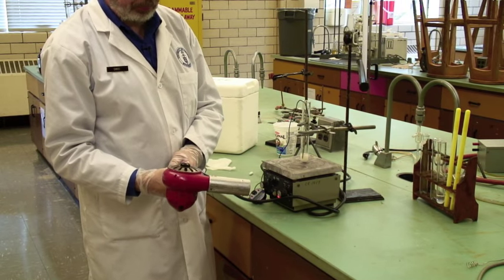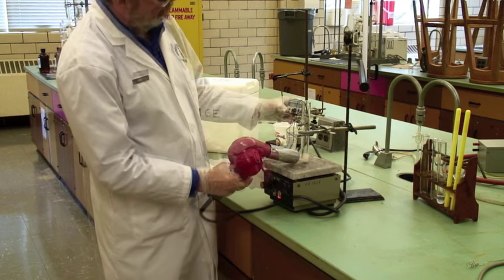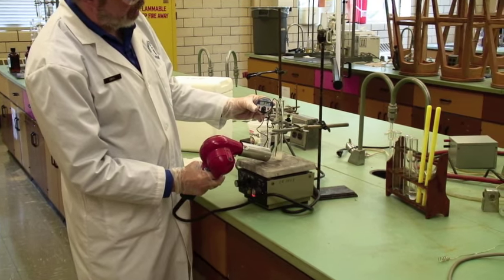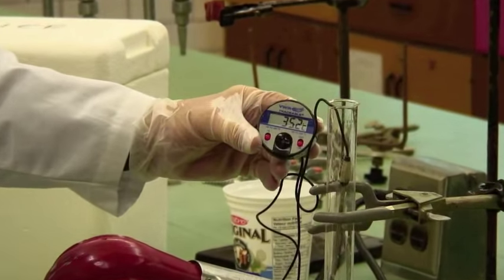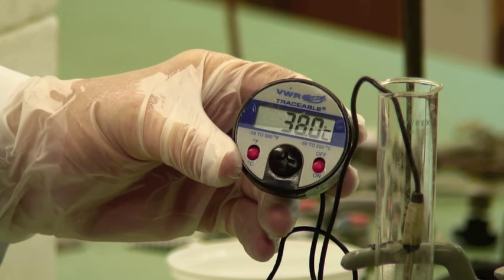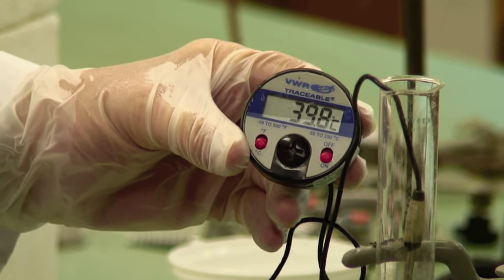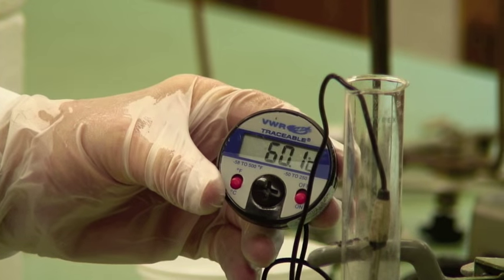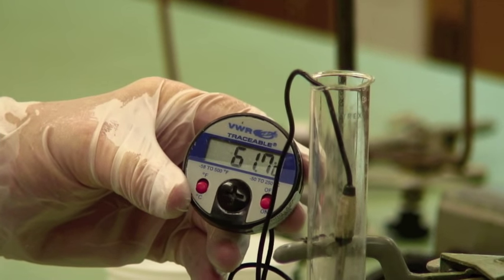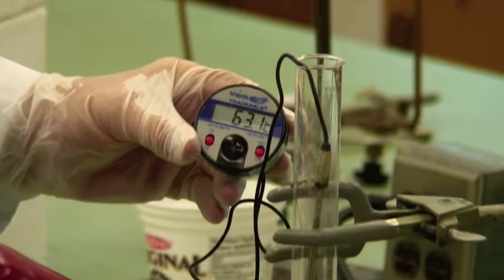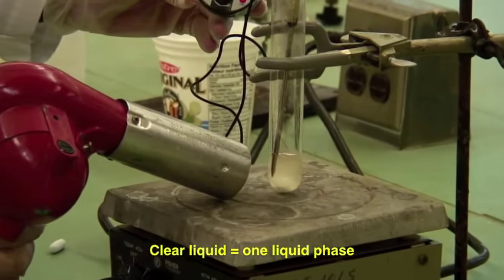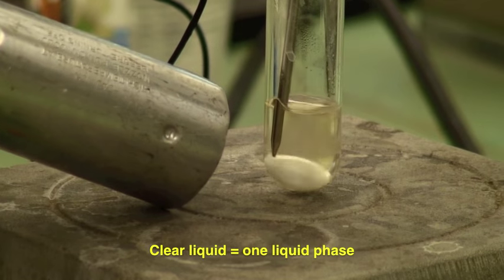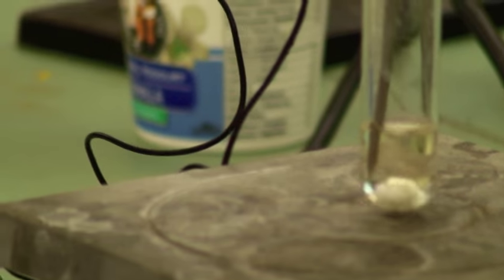That's almost exactly what it is. Technical name is a hot air gun. And you'll see the temperature is going up here. Still cloudy. And look. We've now got a single clear phase.